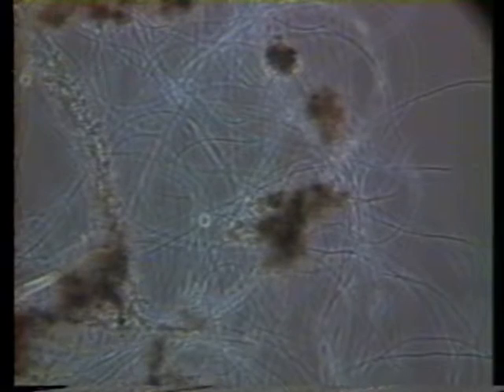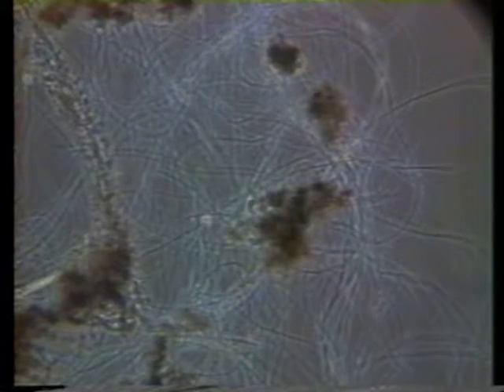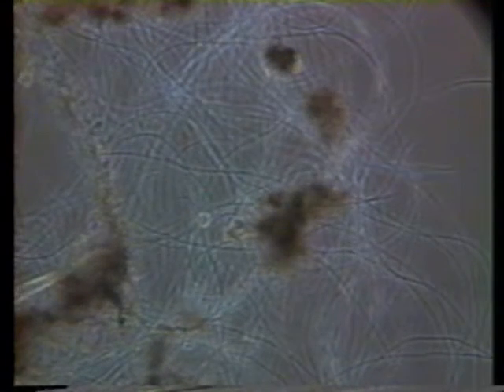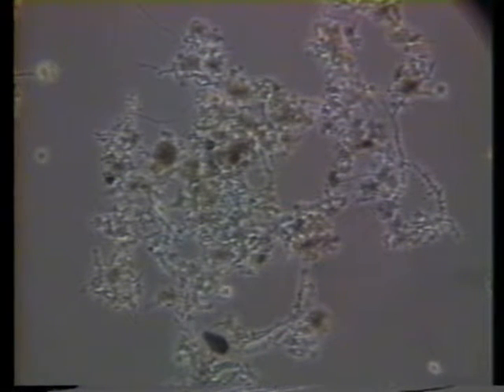There are two types of floc structures that form when sludge bulking occurs. The first is interfloc bridging, when filaments extend from the floc surface and hold the floc apart. The second is open floc, where the filaments grow mostly within the floc and the floc grows around the attached filaments. If a facility has an overabundance of filamentous bacteria, the filaments should be identified and the proper corrective action taken. This overabundance of bacteria in an activated sludge system can be very detrimental to process performance.